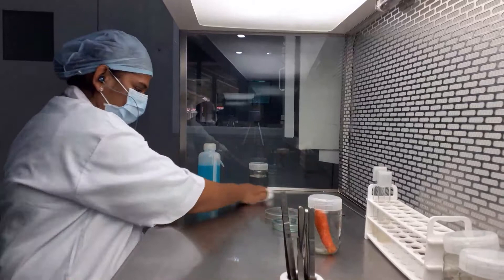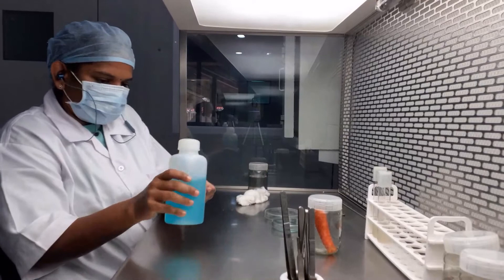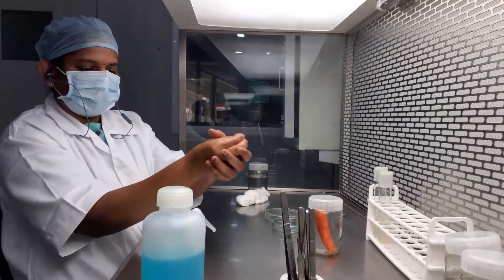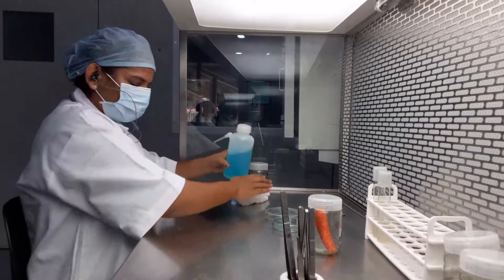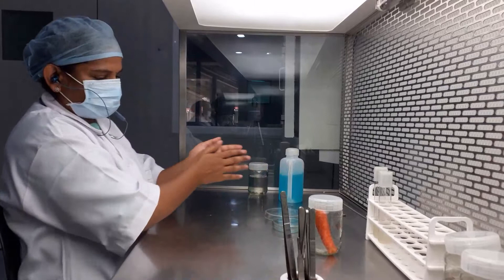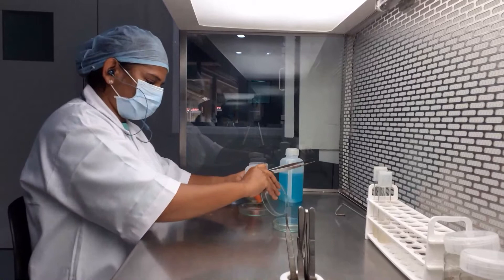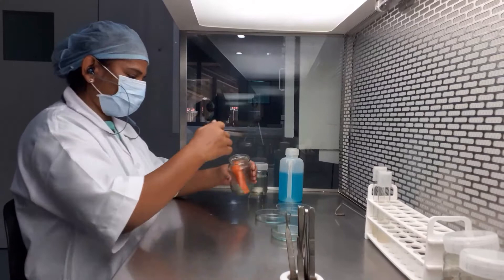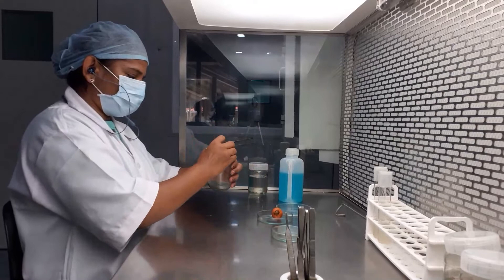You also have to wipe your hands completely with 70% ethyl alcohol. We will cut the explant into small discs.